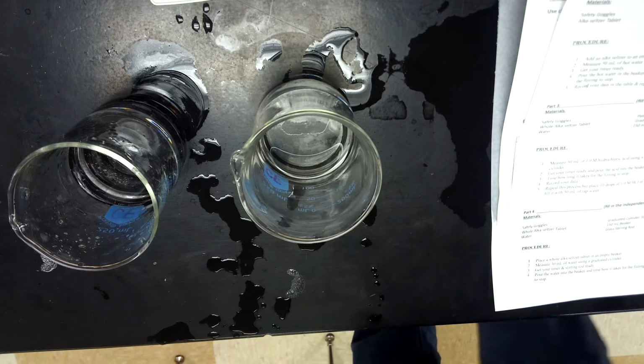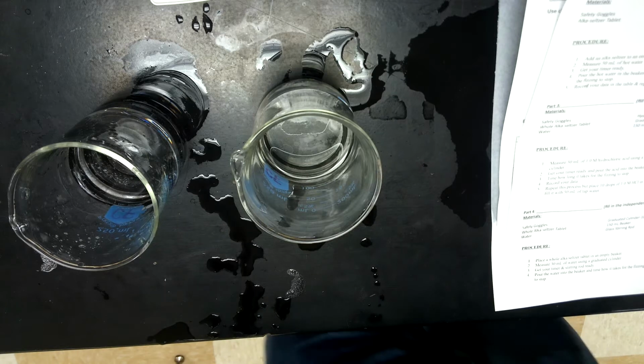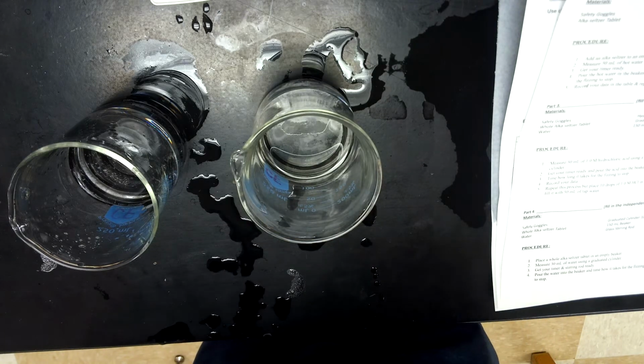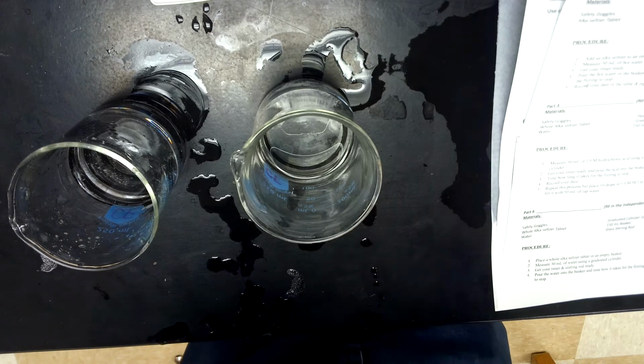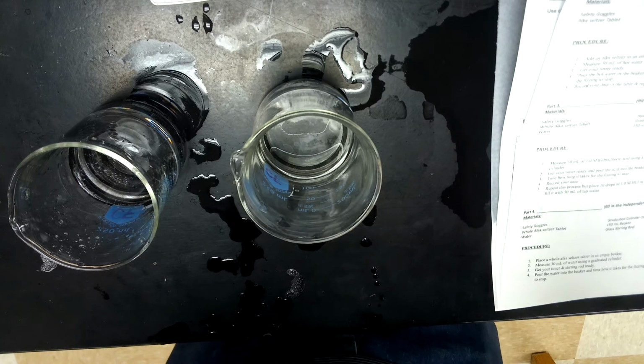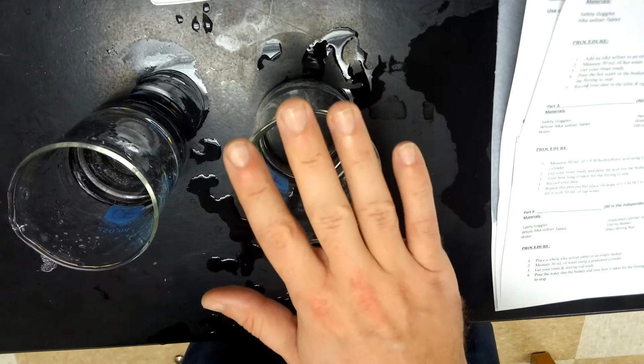Here we go, Alka-Seltzer lab number 3. We're actually going to start on part 3. Look at that coincidence. This is where we're going to do different concentrations of acid. So now hopefully in the back of your mind, you're thinking something like, acids have different concentrations. We've gone over that a few times. In fact, this one is a high concentration.